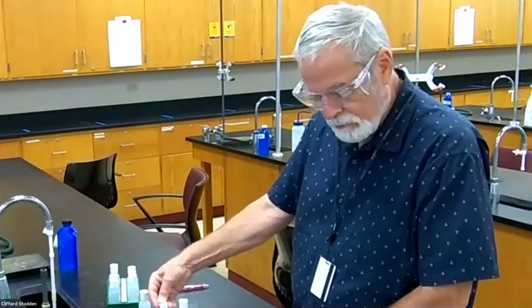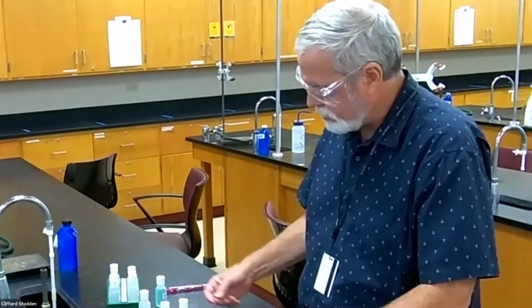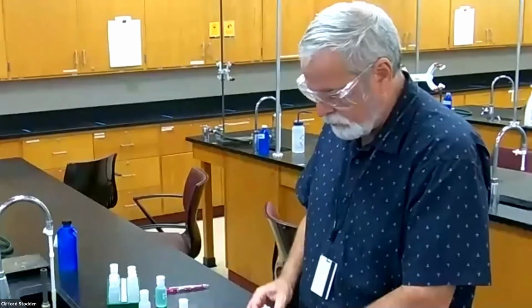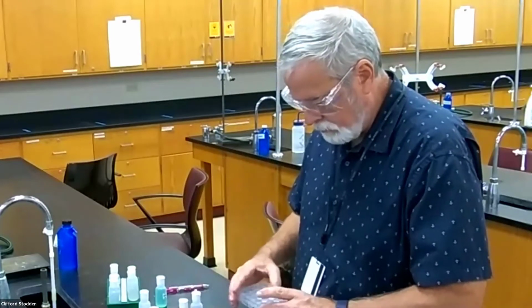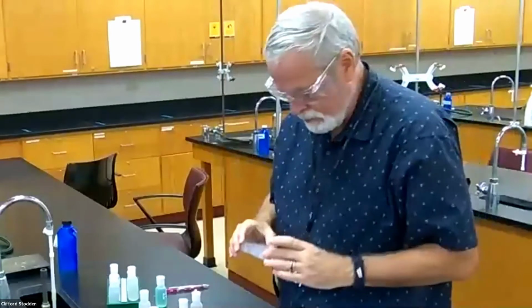either. So now the next one across there is sulfuric acid. So I'm going to put calcium with sulfuric acid. And the possible precipitate there could be calcium sulfate. So I want to see if calcium sulfate will give me a precipitate. So this would be calcium sulfate if it formed a precipitate. Not seeing any cloudiness there at all.